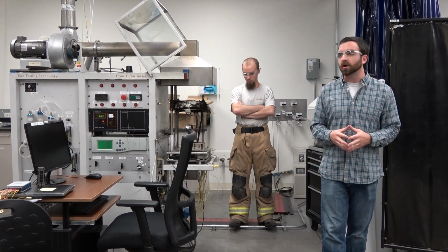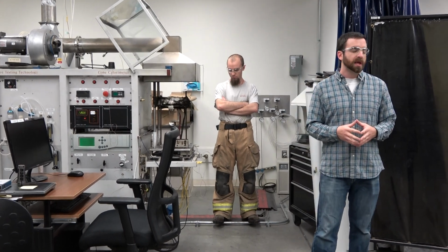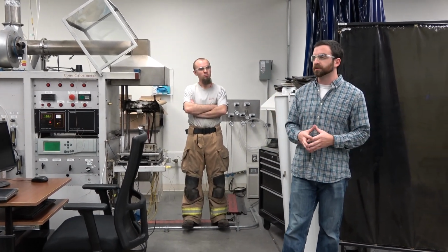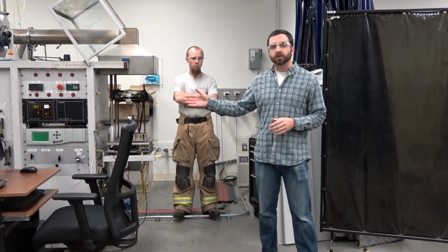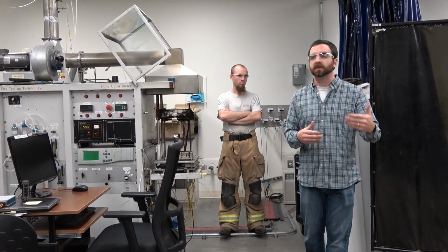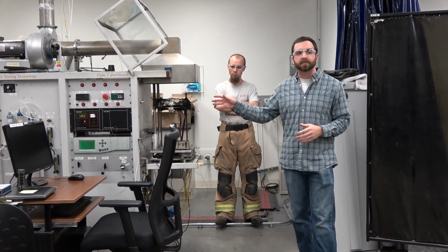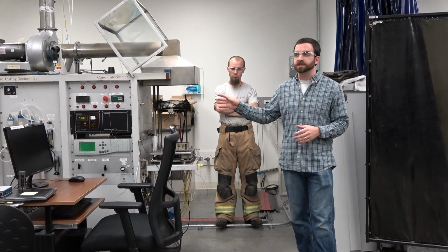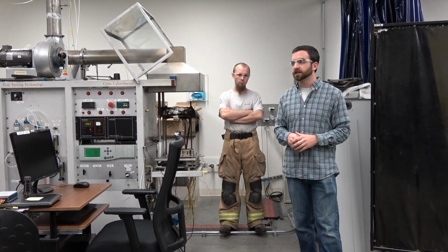So we'll work very often with, for example, a client that's an architectural company, and they need to pass a standard. Let's say it's the ASTM E84 tunnel test. We can start here at the cone calorimeter and get approximate values for their material and do some modeling for how they would perform in something like a 285, 286, or 84 test. This allows for rapid testing and rapid iterations as opposed to paying for a $10,000 ASTM test.